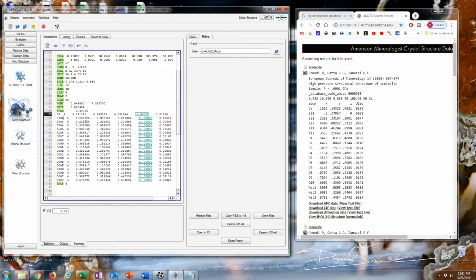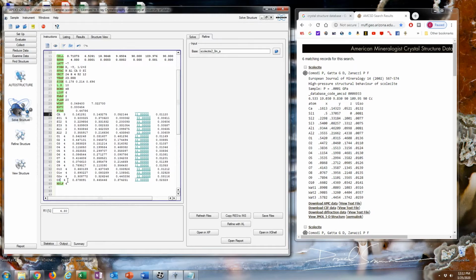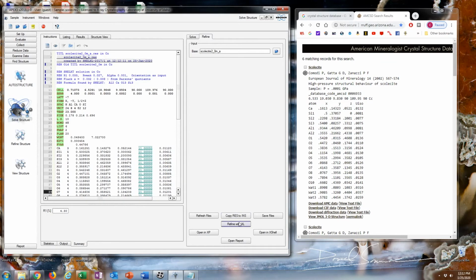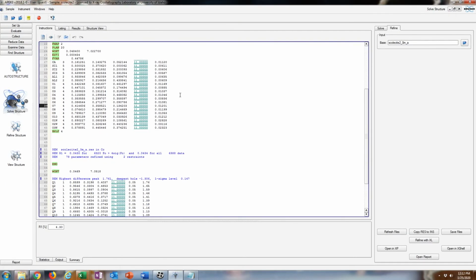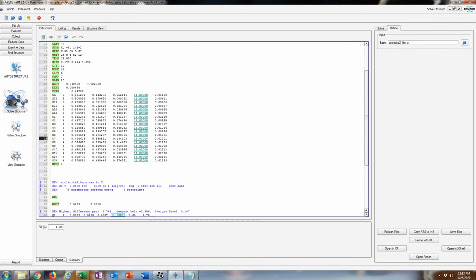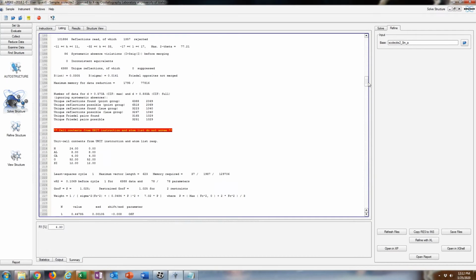And I'm going to rename these really quick, just to make them more similar to their naming here. And then 1, 2, 3, 4. I'm going to rename these water molecules. I think ShelX has a problem with names like that, so I'm just going to call them O1W, O2W. Now these are kind of high here, and that could just be because I'm not using thermal ellipsoids yet.